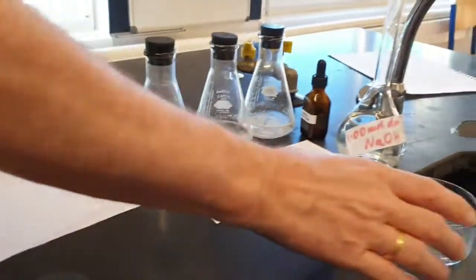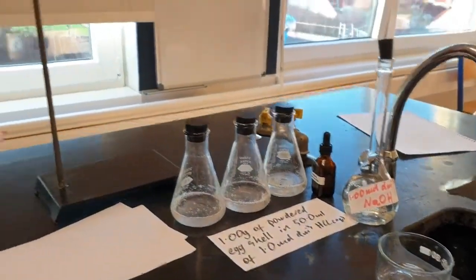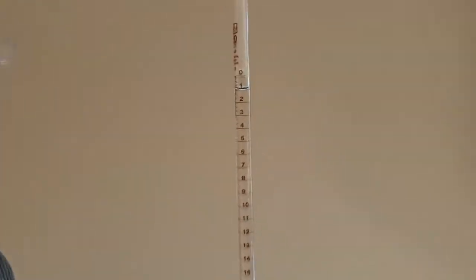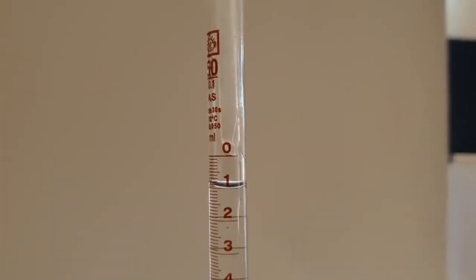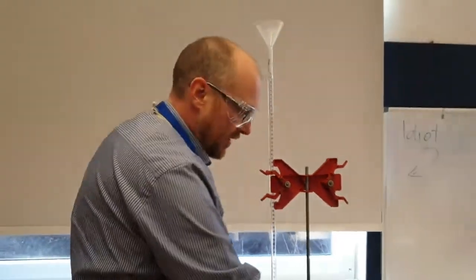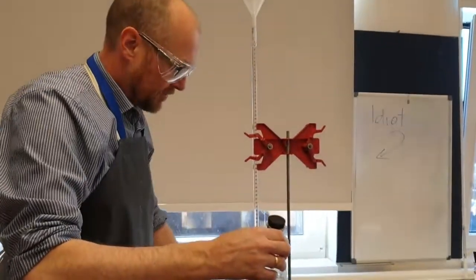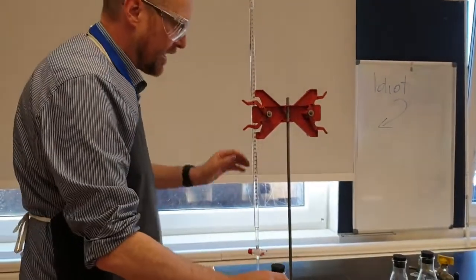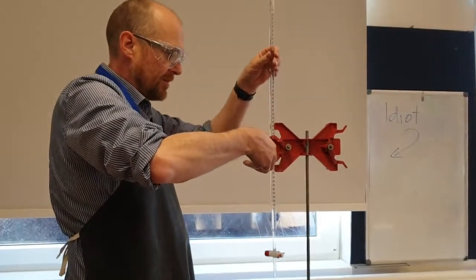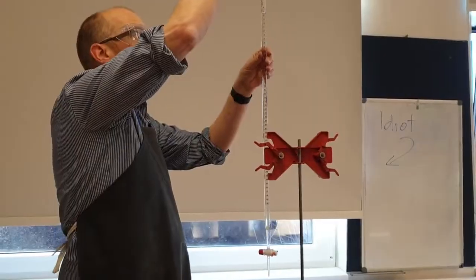So the air gap's now cleared. I can discard this and take my first reading, so my initial titration is exactly on one. No need for the excessive zooming, cameraman. It's fine, it's on one. Alright, so let's do the titration. Put something white underneath so I can see the color change. Raise up the burette, take out the funnel.